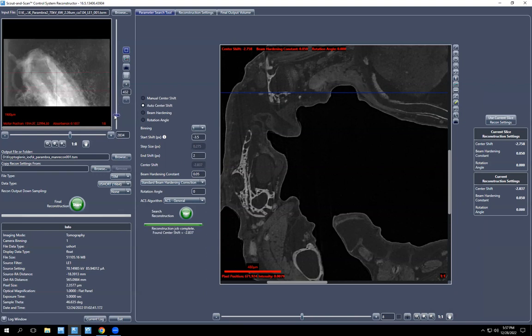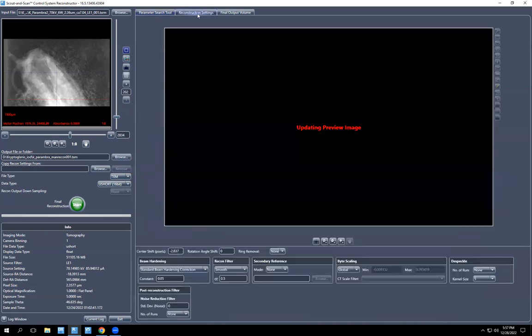So the otoliths are there, at least one of them. And then we go over here to reconstruction settings. And this will take a little bit of time to update, and it should show you the slice that you've chosen with this line. But if it doesn't, you just have to drag it again.